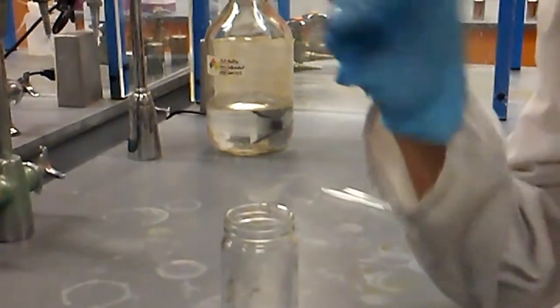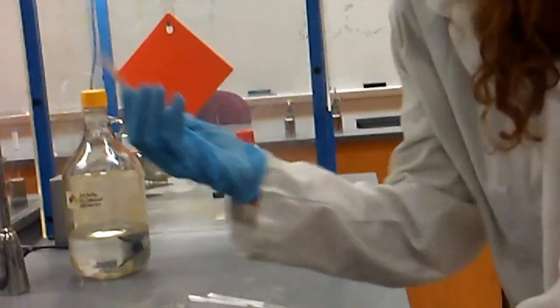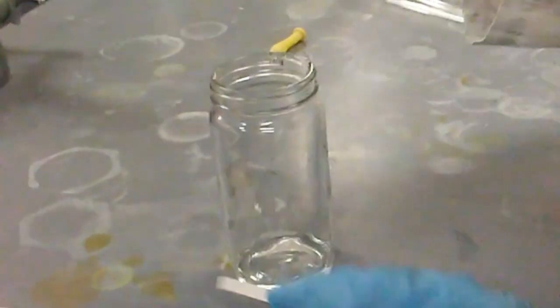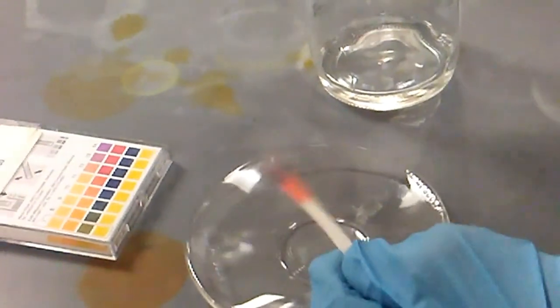Since the sugar and sulfuric acid experiment went so slow, we're going to go up and test the pH. I thought maybe the pH was wrong on it, or the concentration, so we're going to take the pH and see what the real concentration is. I mean, it looks pretty viscous. Dip this in there. Okay. So now we're going to match up the colors.